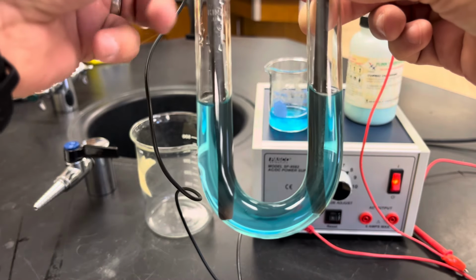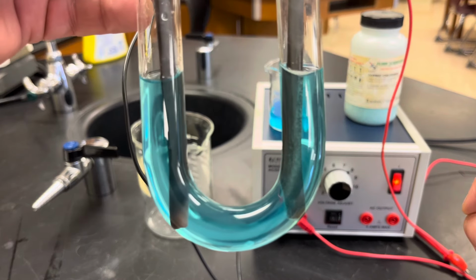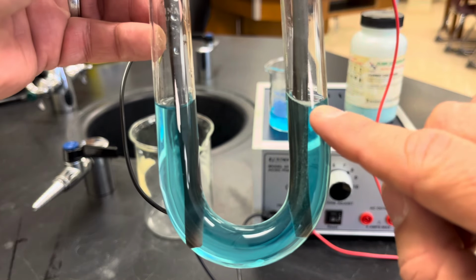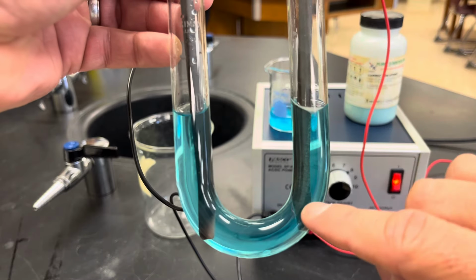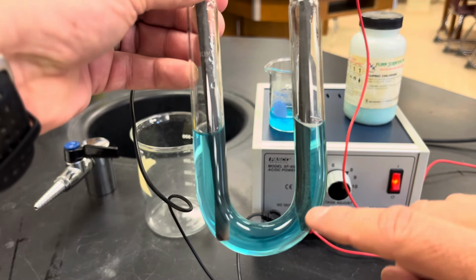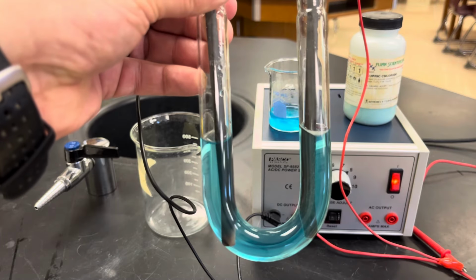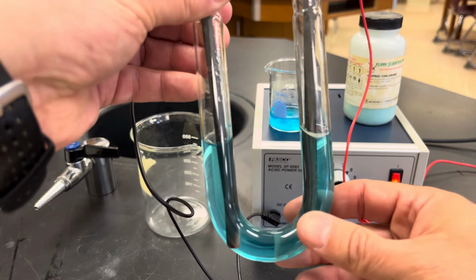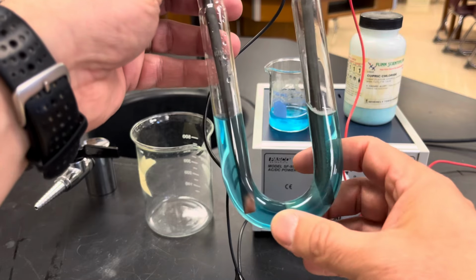And on the other side, I should start to see some gas bubbles. And I don't know if you can see those gas bubbles start to form, but you can see it's getting bubbly here at the top from these gas bubbles at the bottom, okay? And I don't want to let this go very long because the gas that I'm producing here is chlorine gas, okay? And chlorine gas is toxic, but I do want to let this go for a little while so that you guys can see that down here, you can see that copper really start to form here at the bottom.